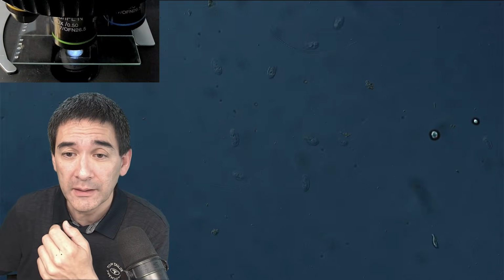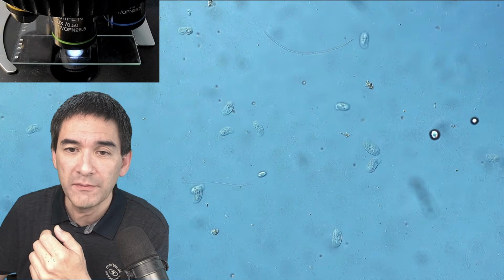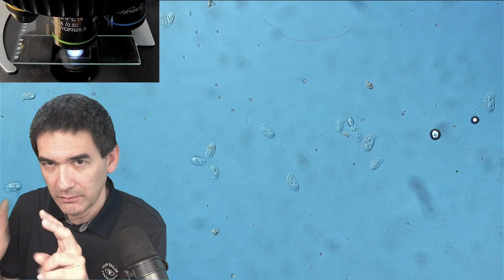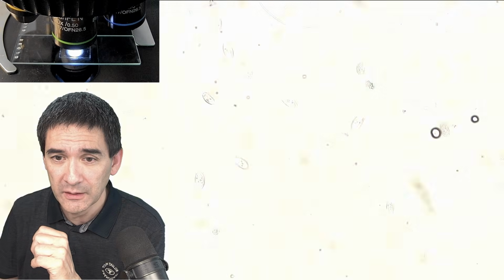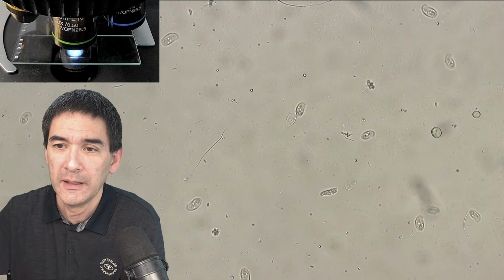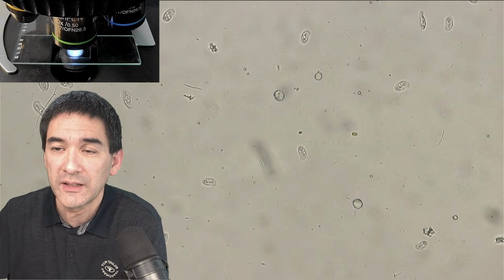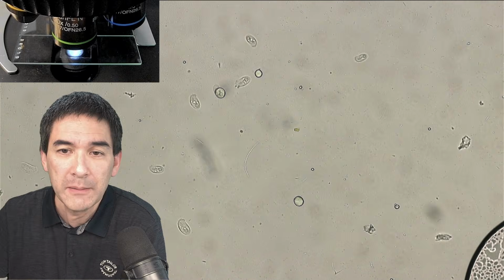Let's go up with the magnification a little bit. Now, the blue background that you see is because of the specific microscope optics that I have. If you're doing that with a normal microscope, then it would look like this. It's a little too bright. So this is regular bright field. It might not look quite as colorful, obviously, but you're still able to see everything, just equally well. It also shows that those ciliates that are swimming around are actually not pigmented.